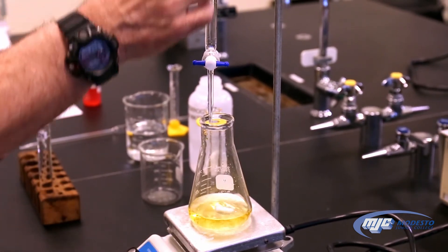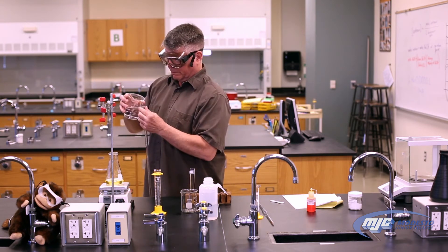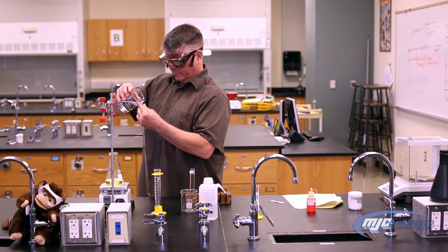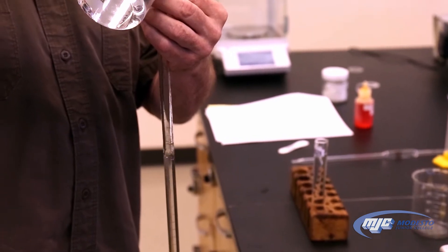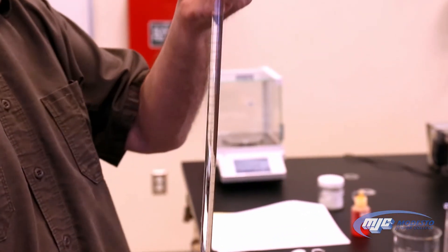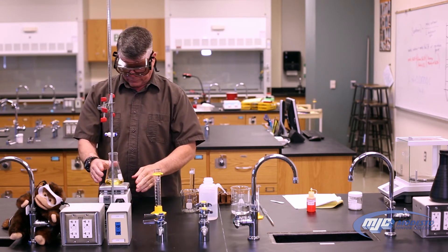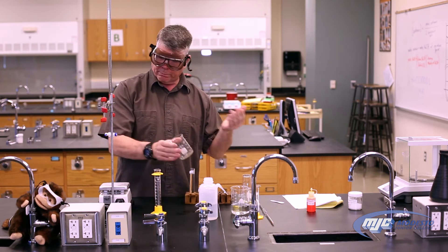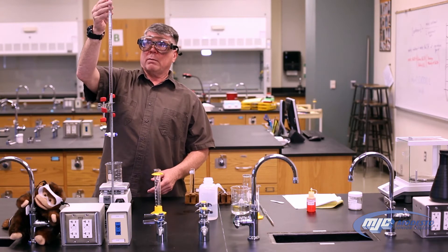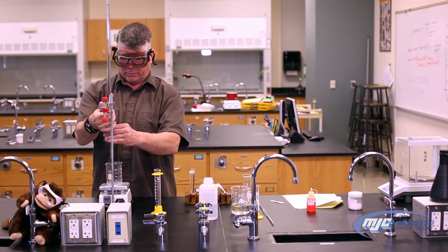Now I'm going to add my stock solution to the burette — I've already rinsed it with DI water and with some of the stock solution. When I fill it up, I want to fill it above the top mark, which remember is zero. Once the burette is full, there will be some air bubbles in the tip that we have to get out. Put a waste beaker underneath the burette and open it up to flush out the air bubbles. Now the level of the stock solution is beneath the zero mark — it doesn't matter where — and we're good to go. That's going to be our initial volume.